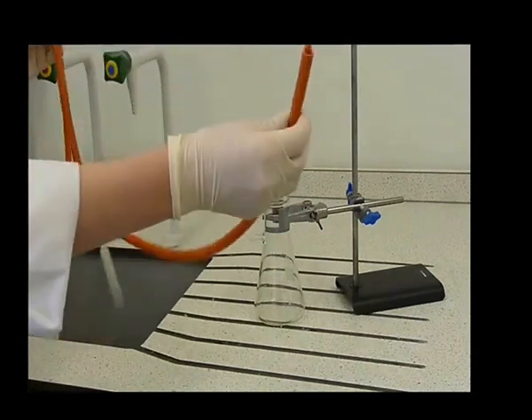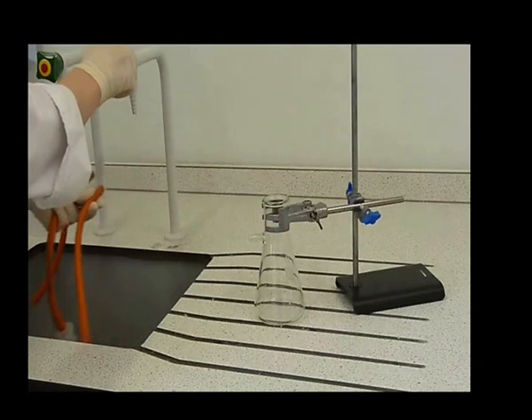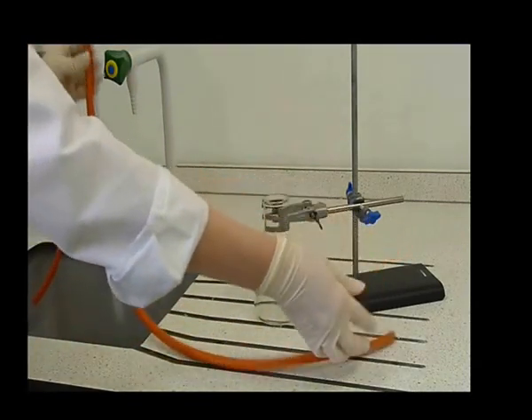Assemble the vacuum pump correctly, wet the ends of the hose with water, and twist to connect the end of the short hose to the cold tap.